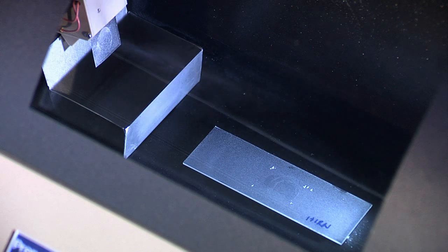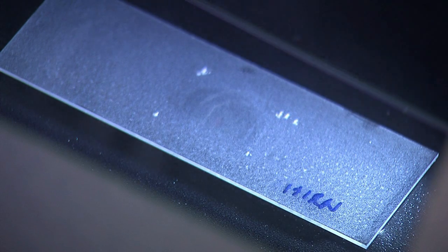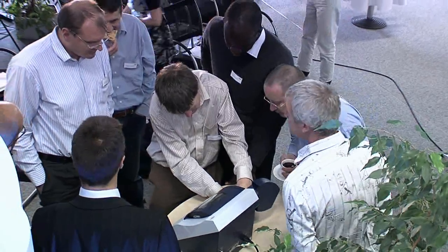It's not a pneumatic spray where you have gas and a gas flow. It is more like rain coming from the top to the sample. This is a wobble — the spray head is tilted by 15 degrees and moves in an oscillating motion. The image prep gives us reproducibility, and with reproducibility comes the possibility of doing larger scale studies.